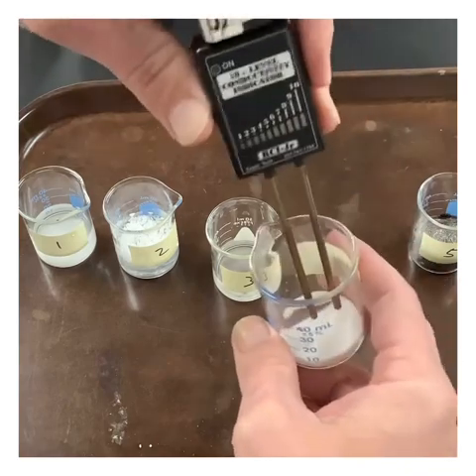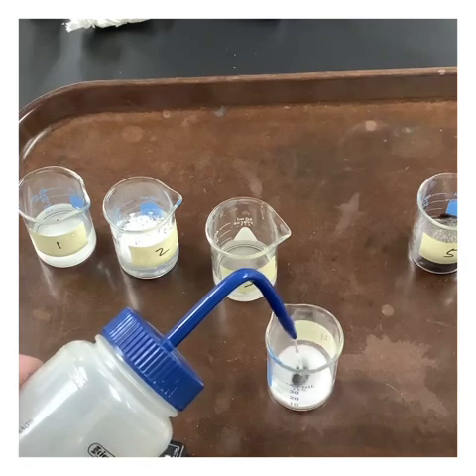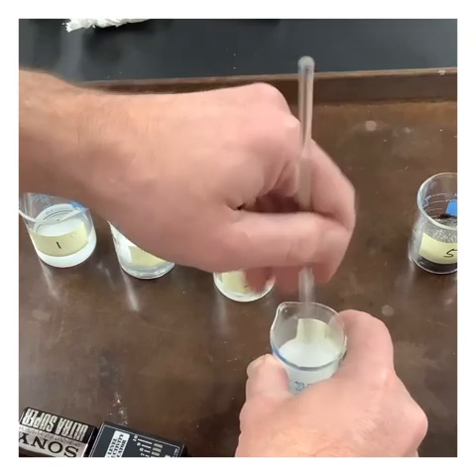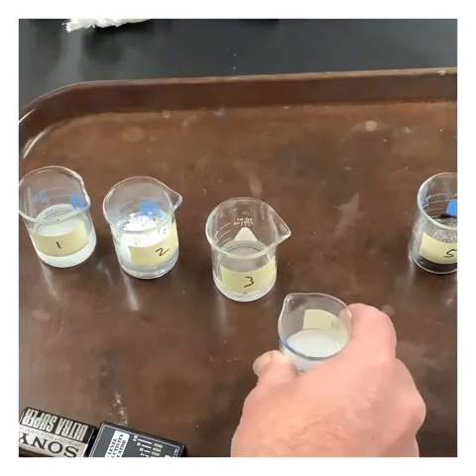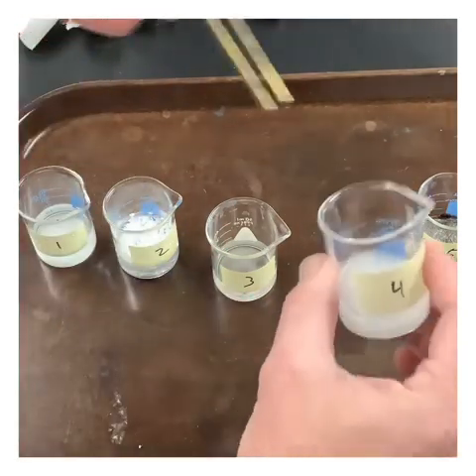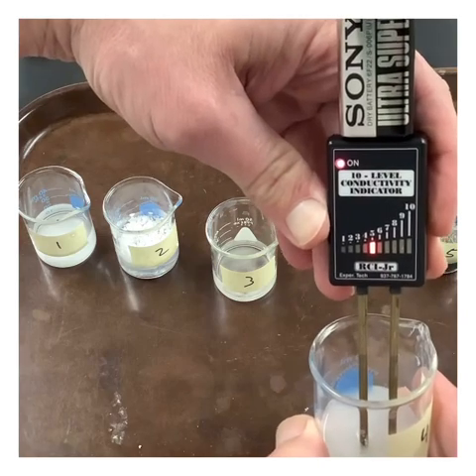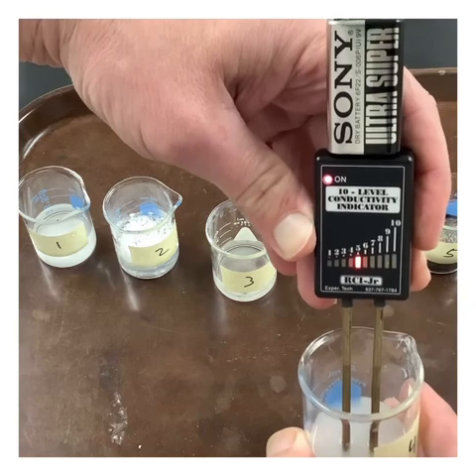We got nothing. Try it as a liquid. All right, this one's pretty obvious, right? We can see that's really different from that last one. We're up around 5. I'd say that's pretty significant.